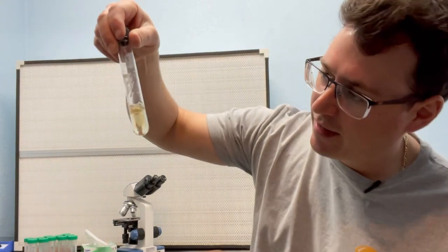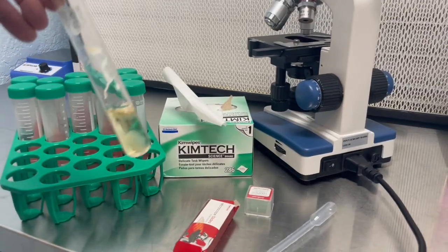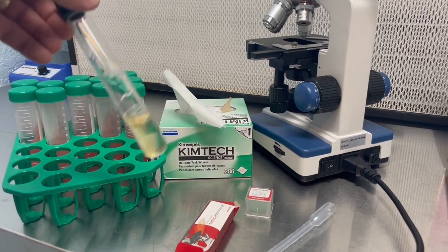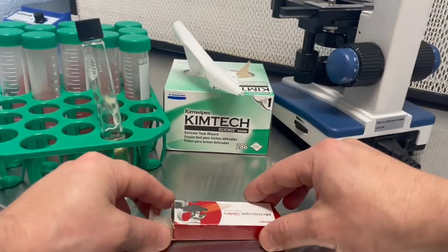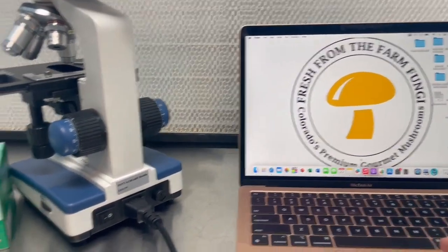Okay, let's flip this around. I'll get to the scope and post up the video on my computer so we can scan around and look for some bacteria or yeast. Hopefully there's none, but I have a feeling that we've got some contaminants, which is why I made this video. All right, so I've got my sample here. I will go ahead and prepare this slide while we get this computer going.